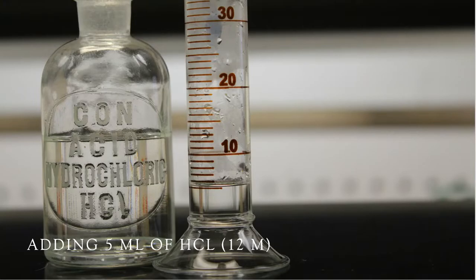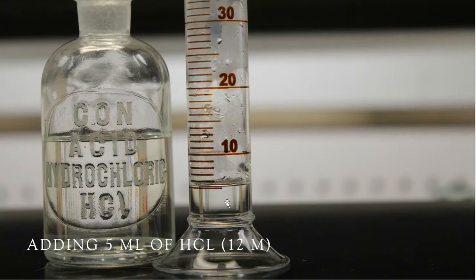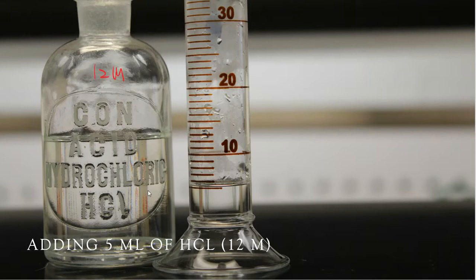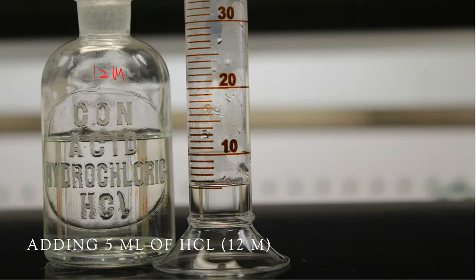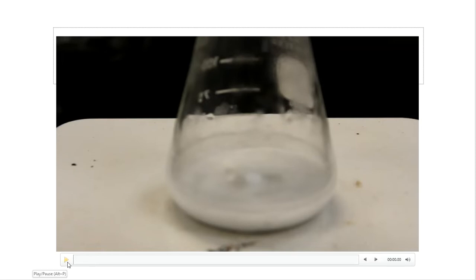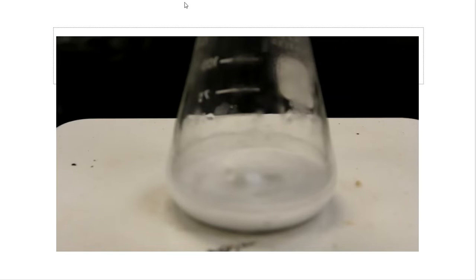Here's the hydrochloric acid stock bottle. The procedure says to add 5 milliliters, so there's my 5 mL of concentrated HCl. Concentrated means 12-molar — that's as concentrated as it gets, so I'll round to a nice even 12 molar. Here comes the addition of hydrochloric acid.